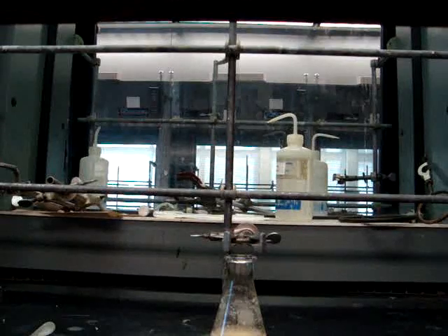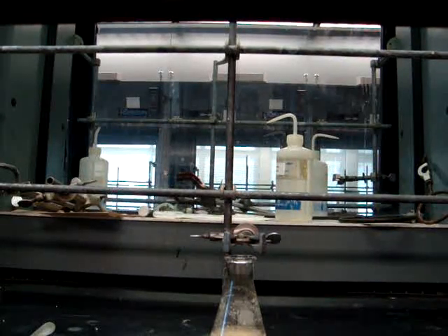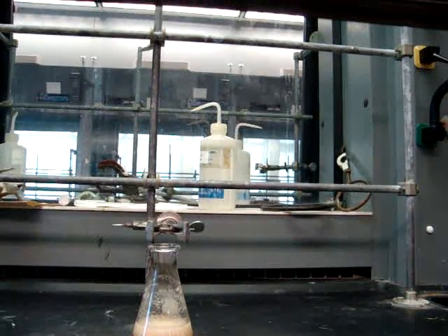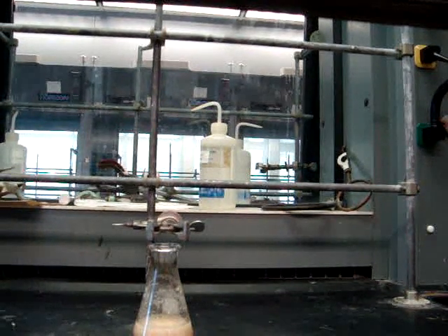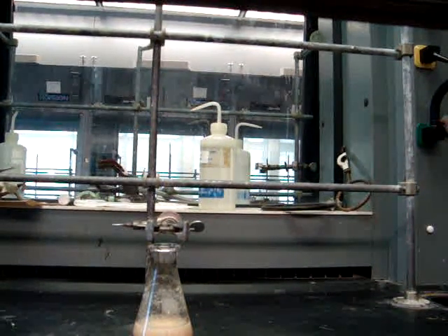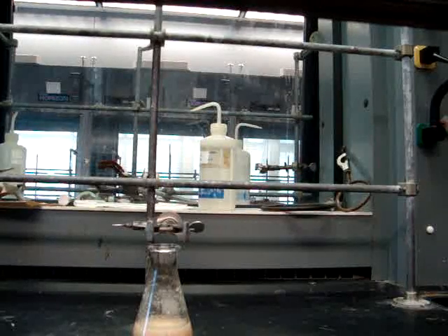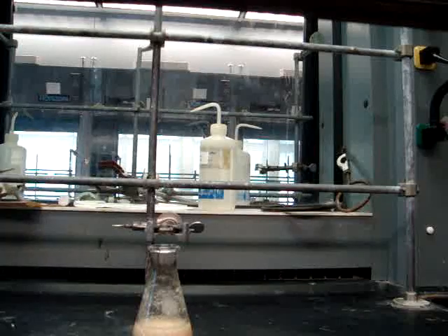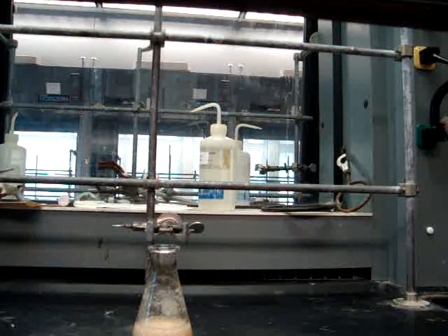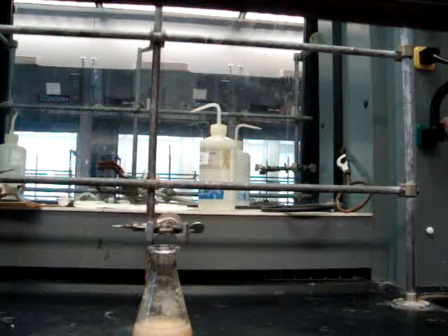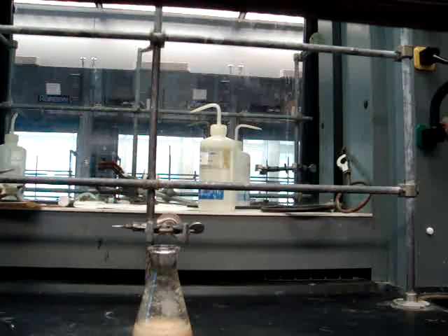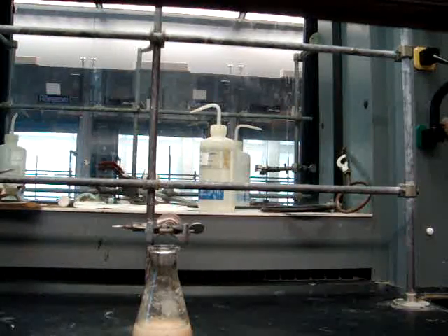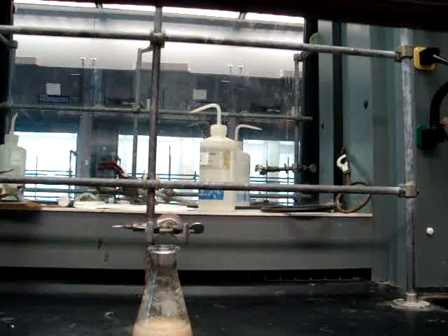As you've seen before, we dissolved 5 grams of isoborneol in 15 milliliters of glacial acetic acid. We then added 50 milliliters of Clorox over the range of 5 minutes. We then cooled the flask to keep the internal temperature in the range of 15 to 25 degrees Celsius. As you can see, a white precipitate started to form. Then we allowed the mixture to stand at room temperature for 30 minutes with swirling every 3 minutes.